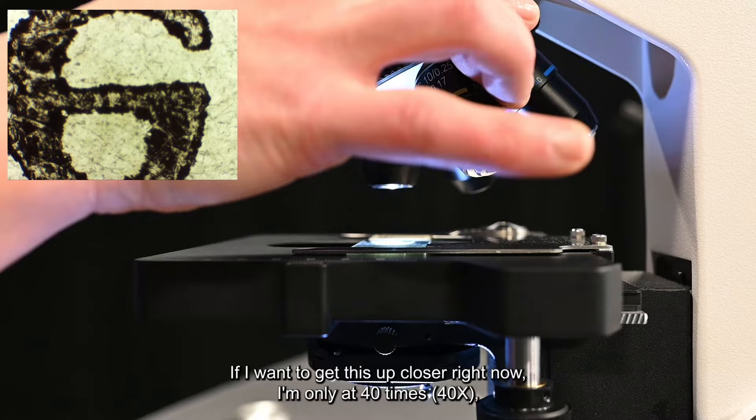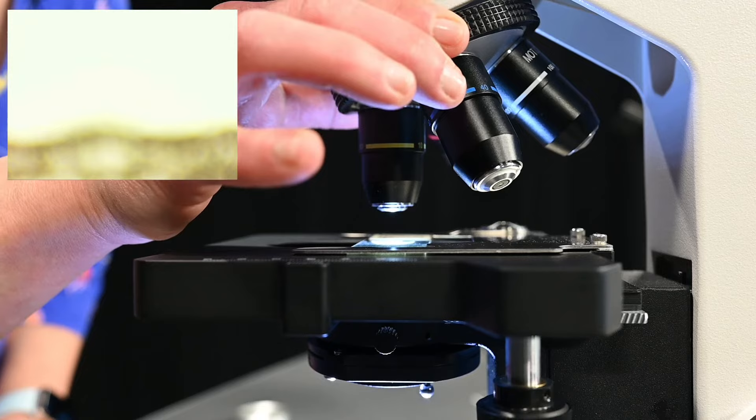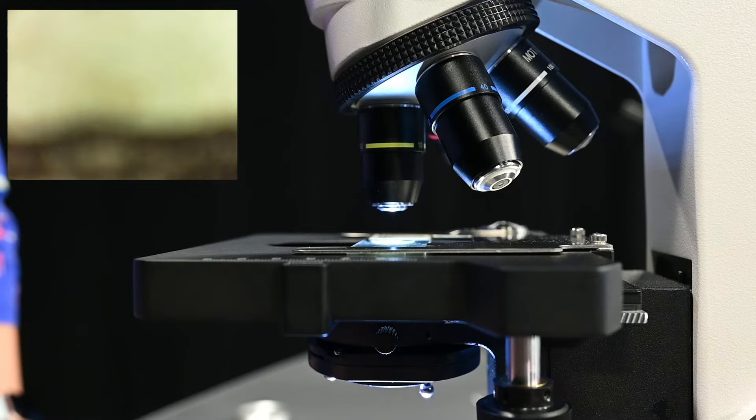If I want to get this up closer, right now I'm only at 40 times. I'm going to twist the objectives, click it into place, feel the click, hear the click. We're at 10 times 10 which is 100 times.